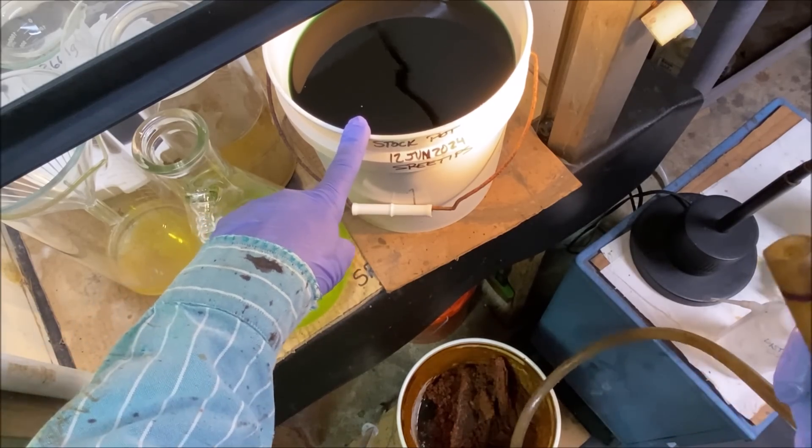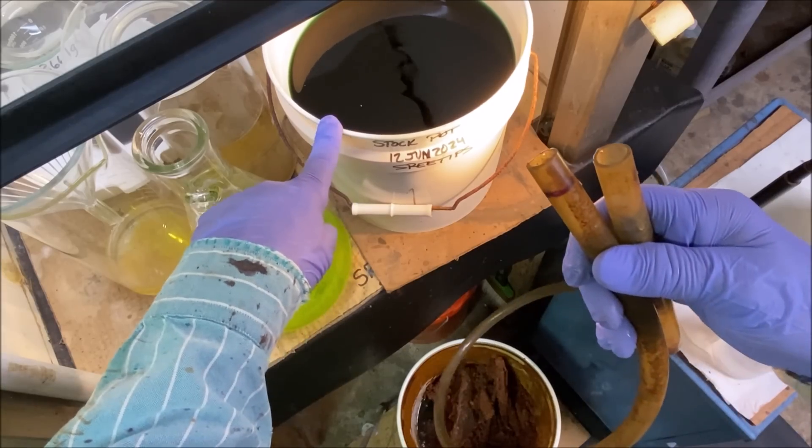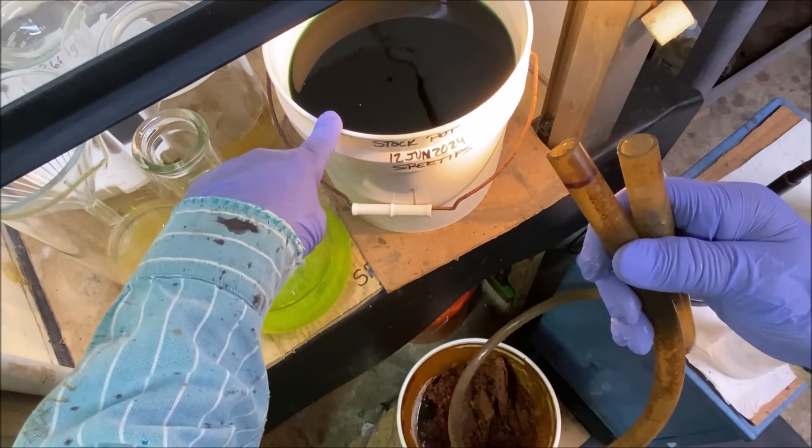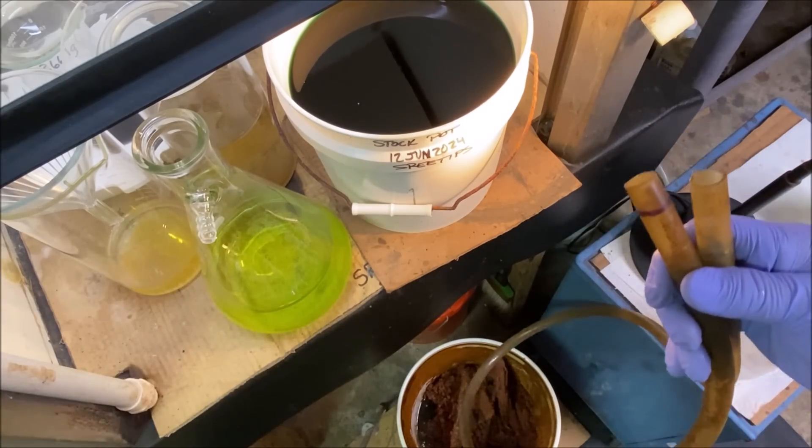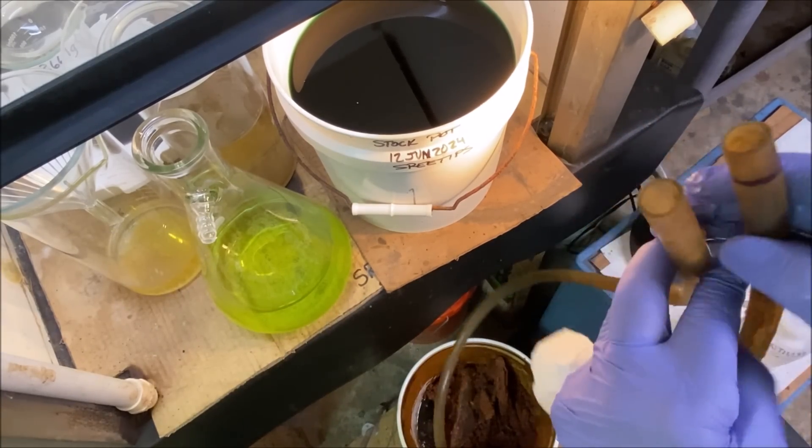The stock pot is going to have pieces of copper in it. And right now we're going to siphon out this copper solution down into my waste treatment bucket down here that's full of iron.